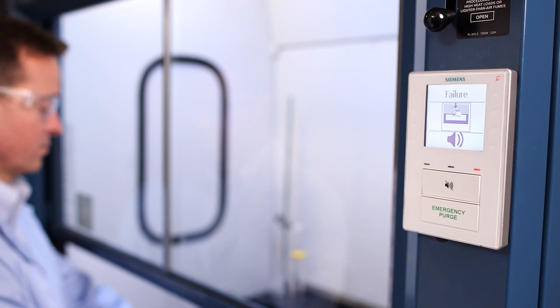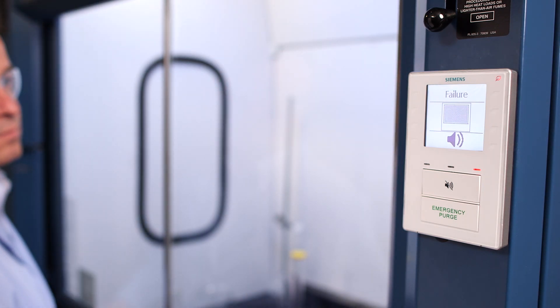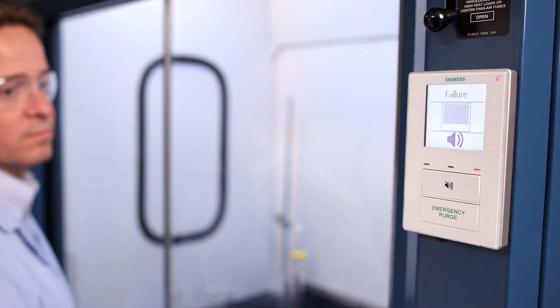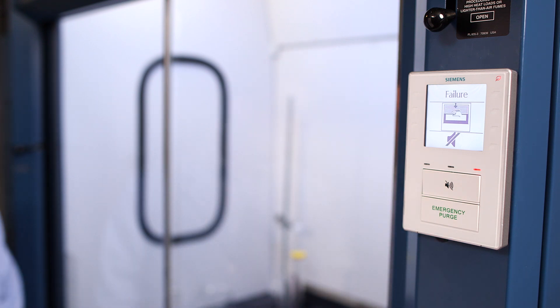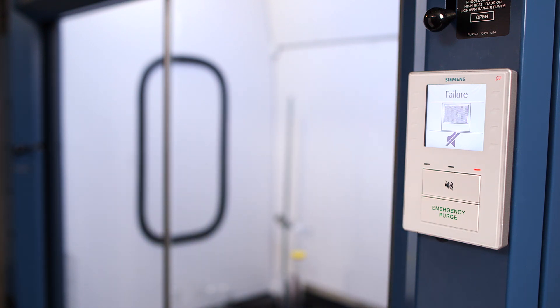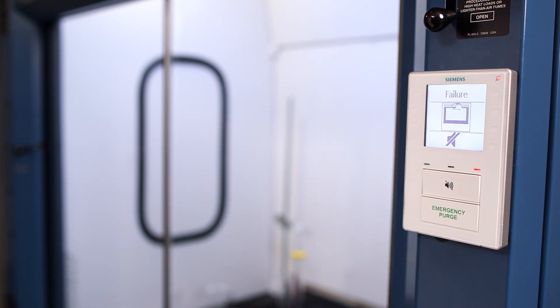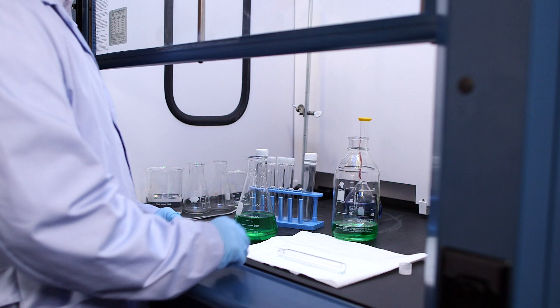The lab tech sees and hears the alarm, closes the hood, and can press the silent alarm button to mute the audio. Reading the display message, the technician knows exactly what to do.